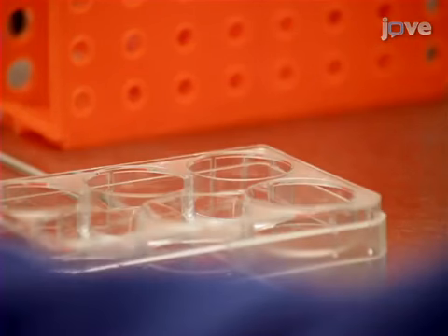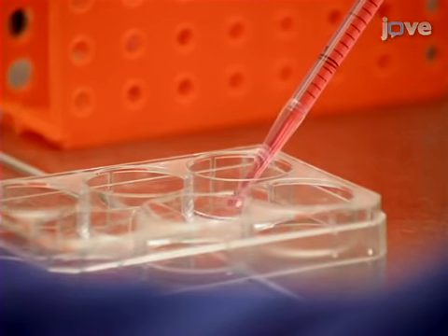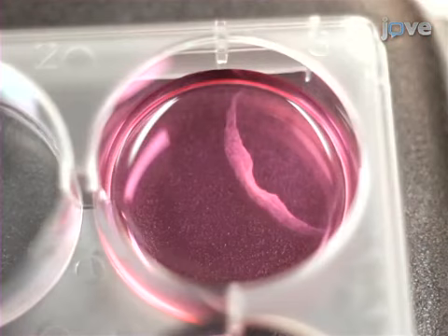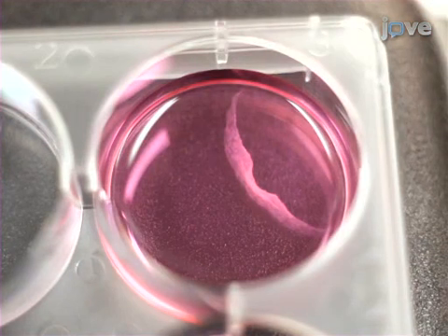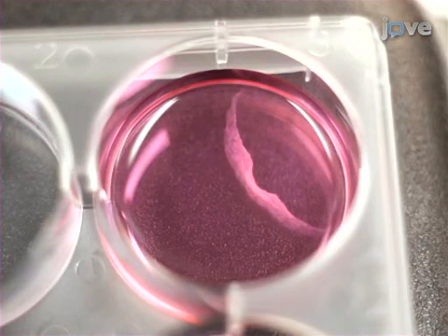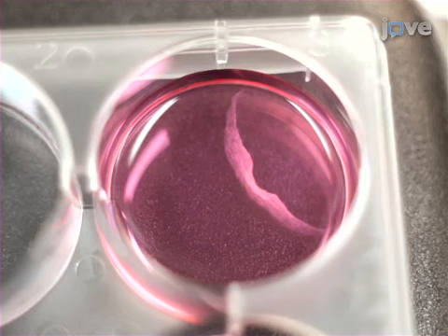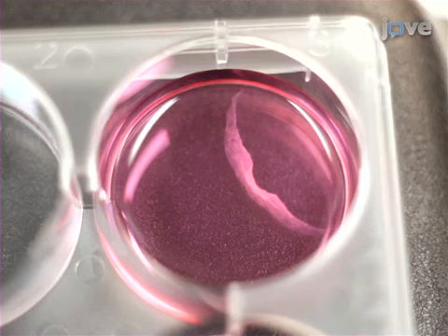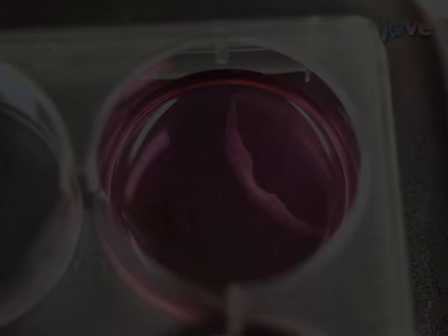Refeed the cells every two to three days with two to five milliliters of fresh media. A thick layer of cells embedded in extracellular matrix, visible to the naked eye, will form at the end of six weeks. Depending on the cells used, the visible matrix may form sooner or later and may begin to detach.